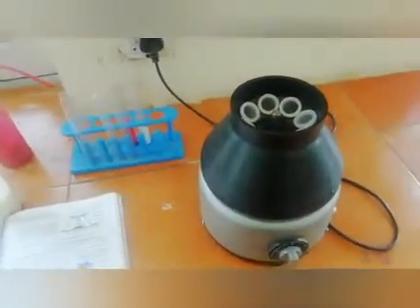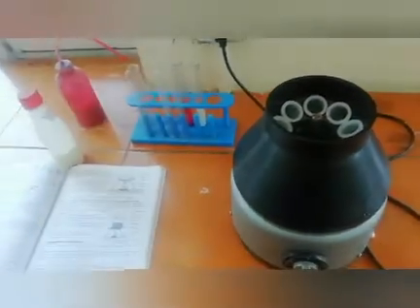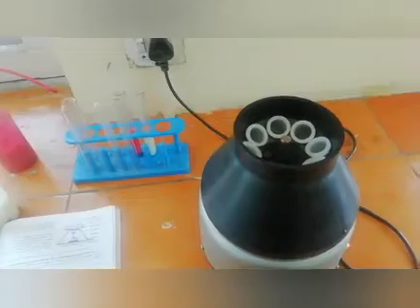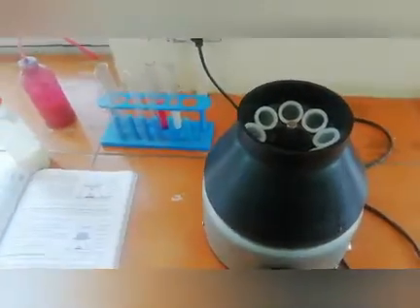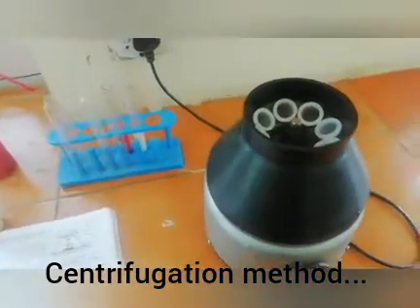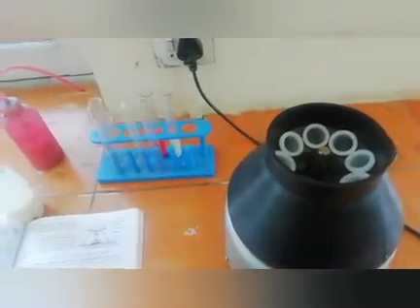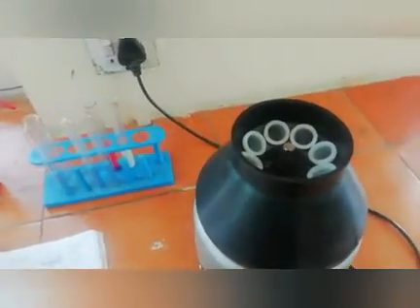So let's start. Dear students, welcome to this practical of chemistry. Today, I'm going to tell you about separation with the help of centrifugation. So what is centrifugation? This is the centrifugation machine, as you can see, and I'm going to tell you how to separate a solution with the help of this machine. Okay, so what is centrifugation?